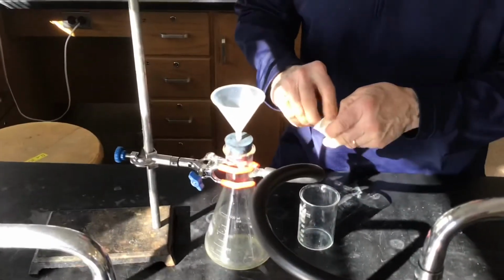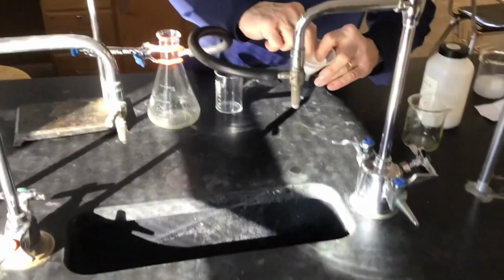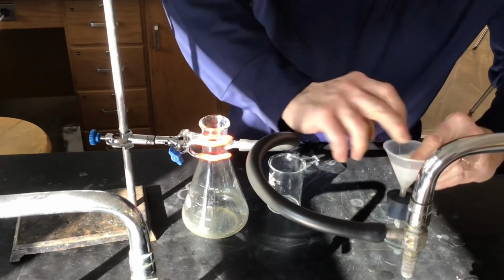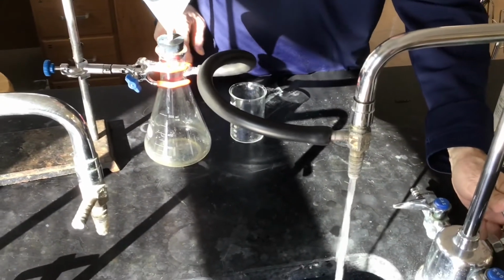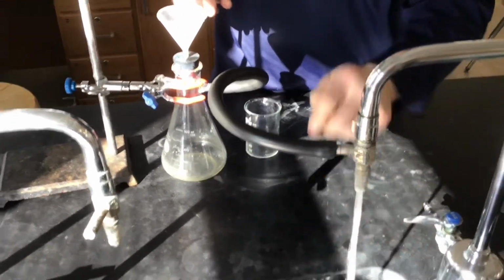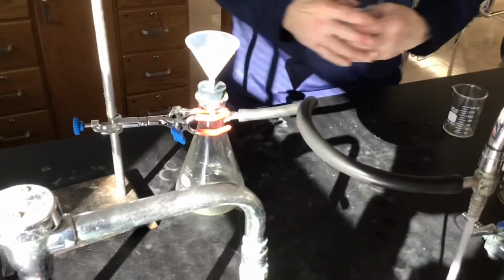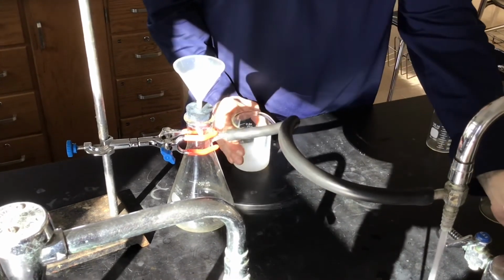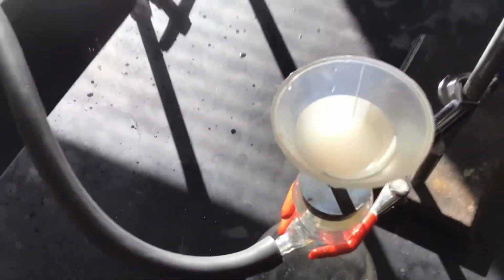Okay, so we're just going to rig this up. This is a setup to do suction filtration. So we're going to use some vacuum power to help speed up the filtering process. So we just fold the filter paper into a nice cone shape. We'll get it packed into our funnel. When we turn the water on, we get a suction effect. The water rushes through the nozzle here, sucks air through this nozzle on the flask. So we create a vacuum down here, and that really speeds up the filtering process. That vacuum effect pulls the water down through it. Right. And it traps the solid up there. The precipitate's being collected in there.